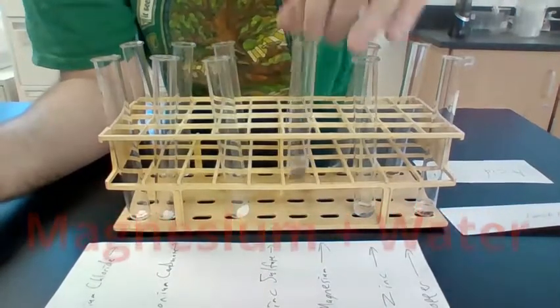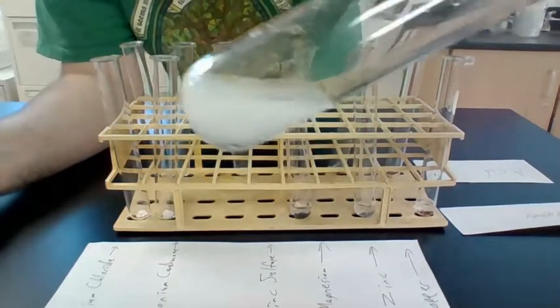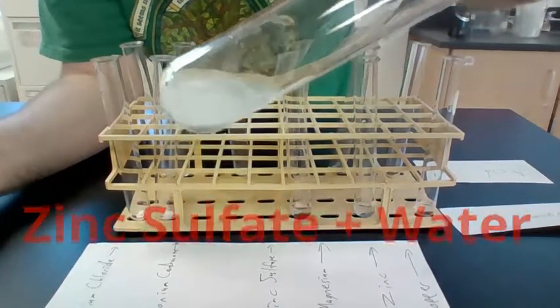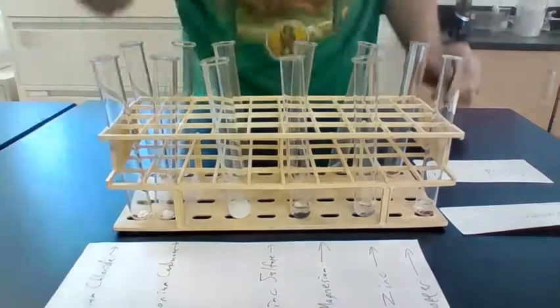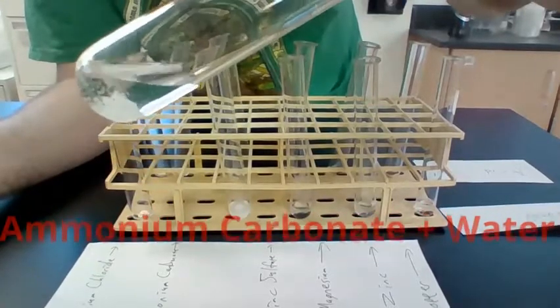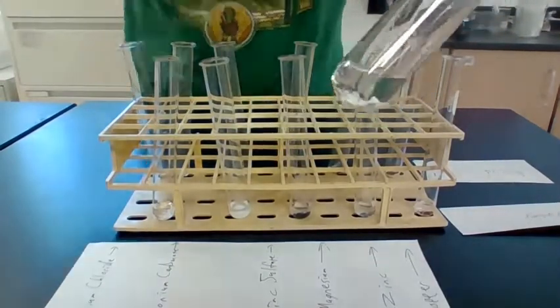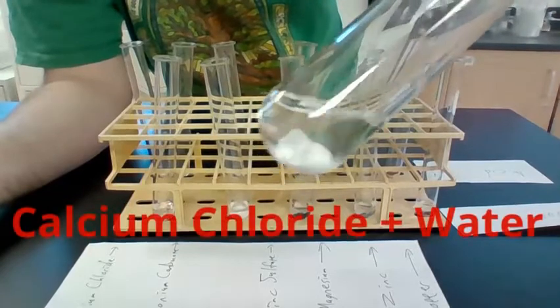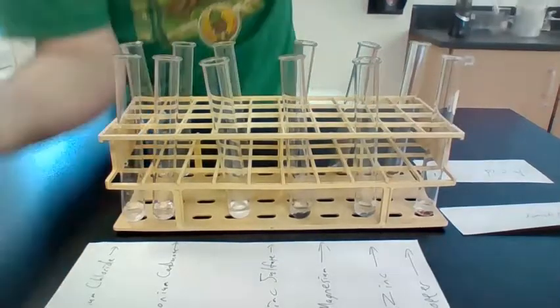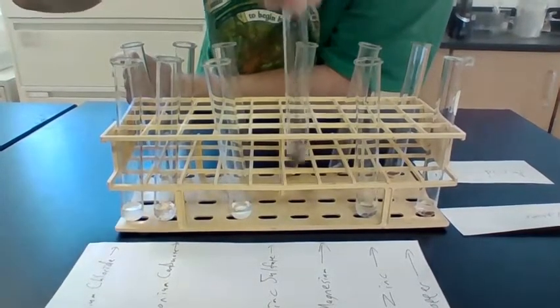Did the magnesium change? Let's give these a swirl and check back on them to see if anything happened.